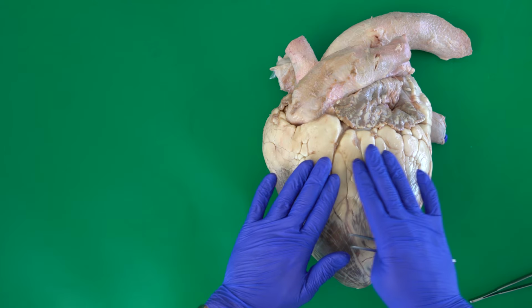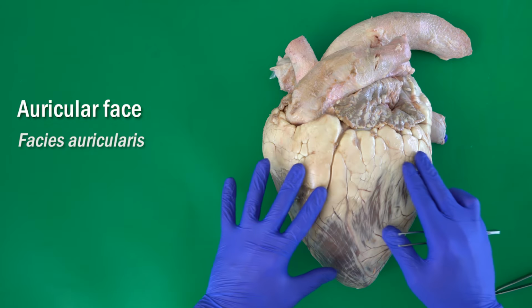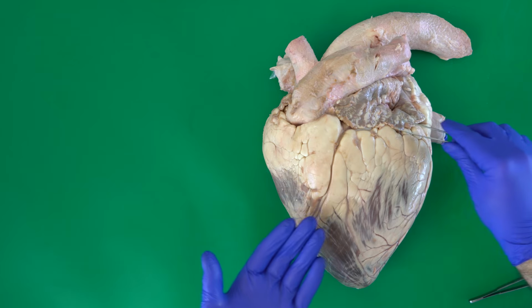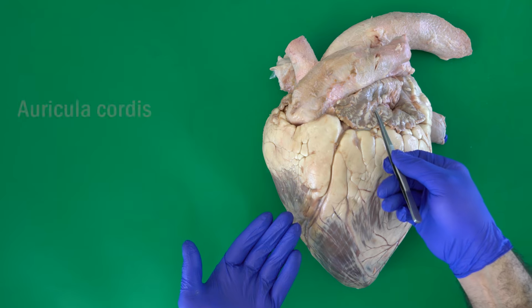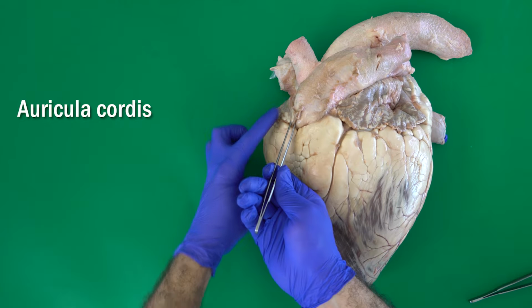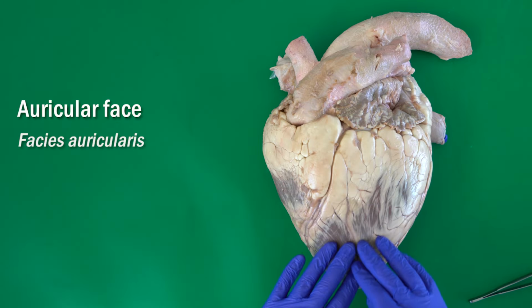The left face of the heart is also called the auricular face. Why auricular face? Because this is the view where we can see both auricles of the heart. This is the left auricle and this is the right auricle here. So in this view we can see both of them. That's why we name this face the auricular face of the heart.